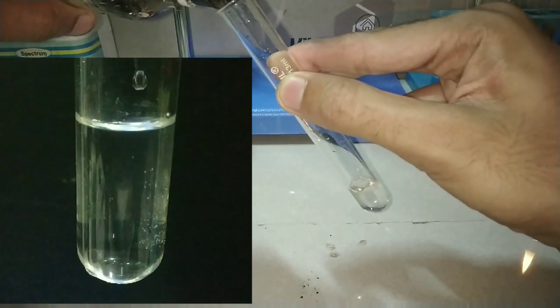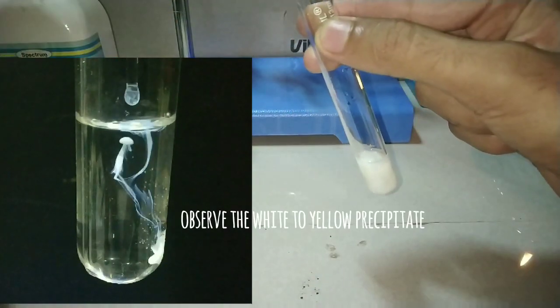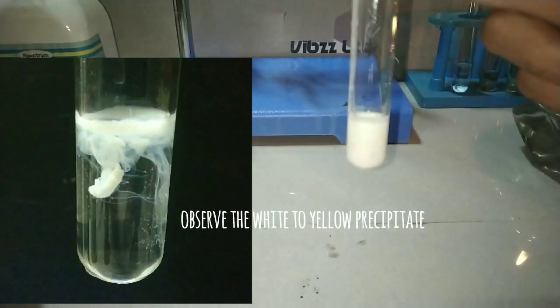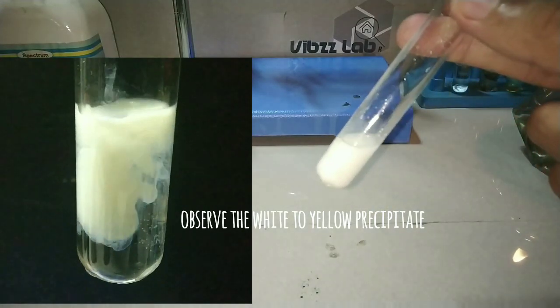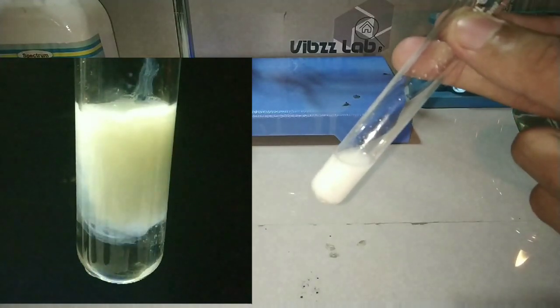You can see that when I added the silver nitrate solution, there is formation of a yellowish white precipitate — it is called a cream colored precipitate.